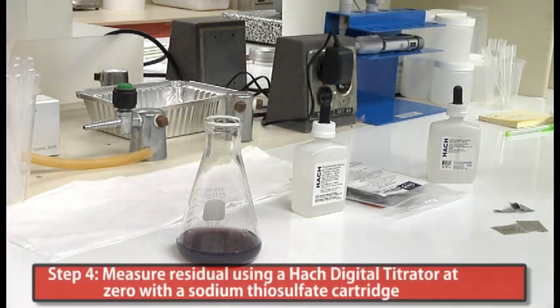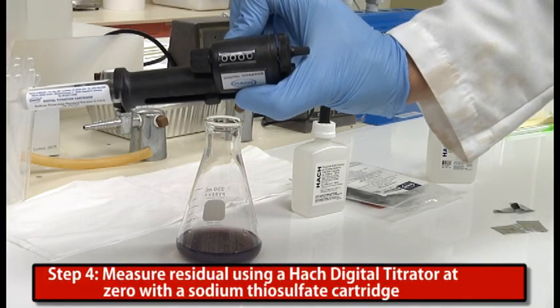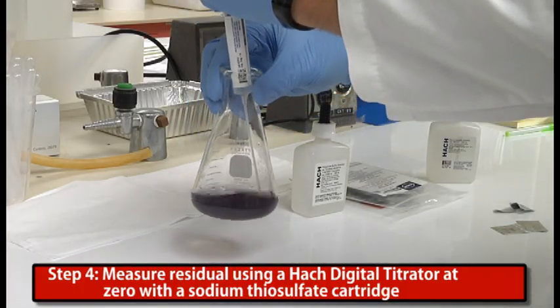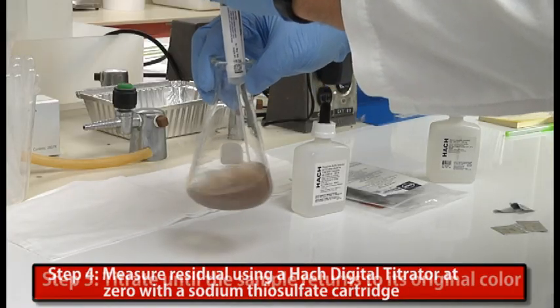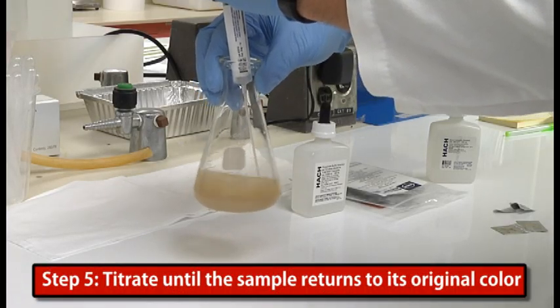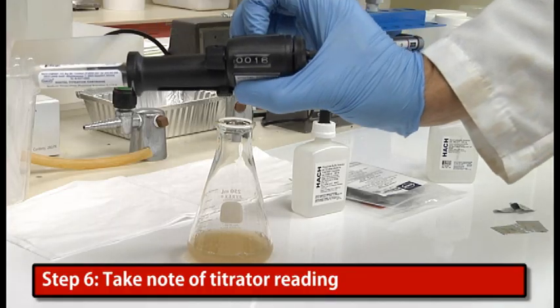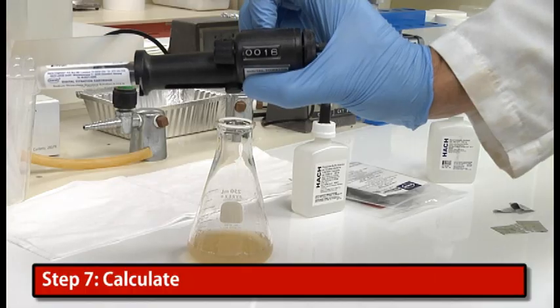So to do that, we're going to use a Hach digital titrator using a sodium thiosulfate cartridge. With the titrator zeroed, we can begin titrating in, and our goal is to titrate until we reach an endpoint where the color changes from that dark purple to our original color. Once we reach that endpoint, take note of the titrator reading, and we can then calculate how much residual we have in our sample.